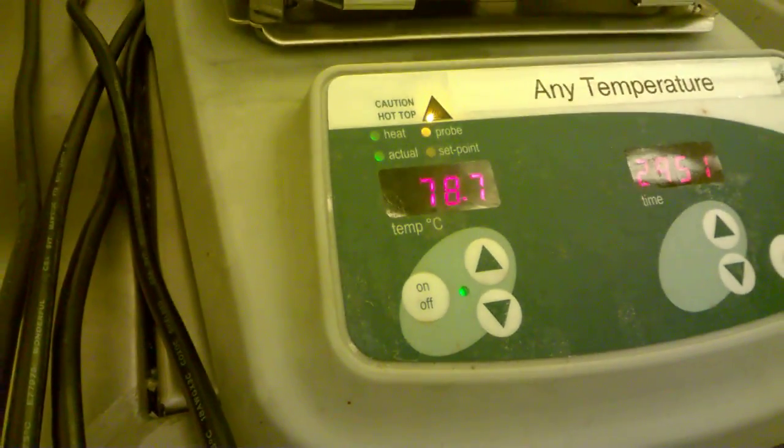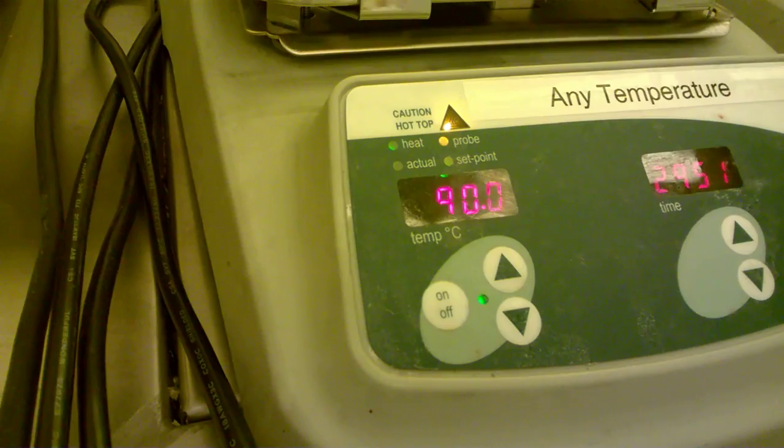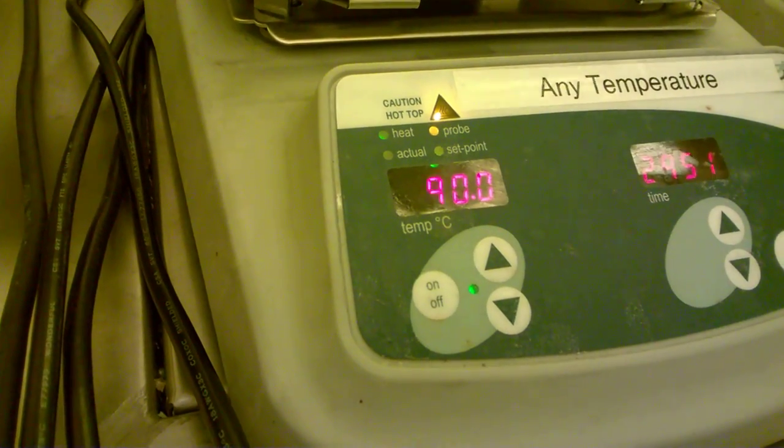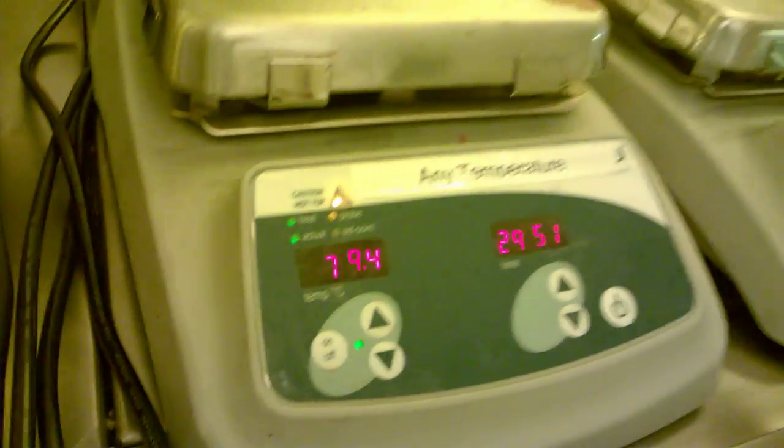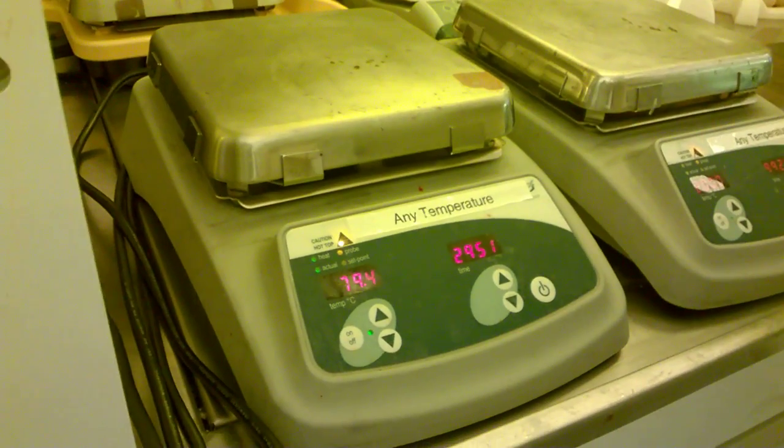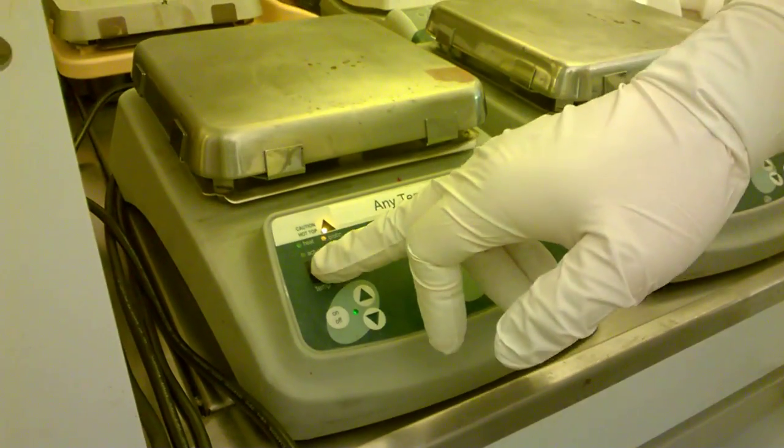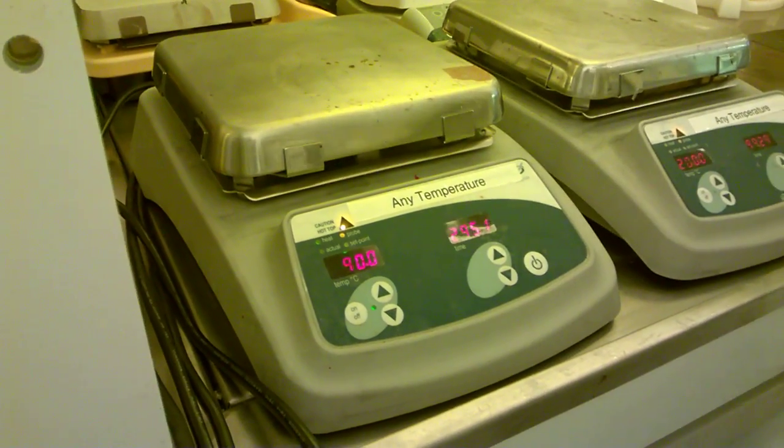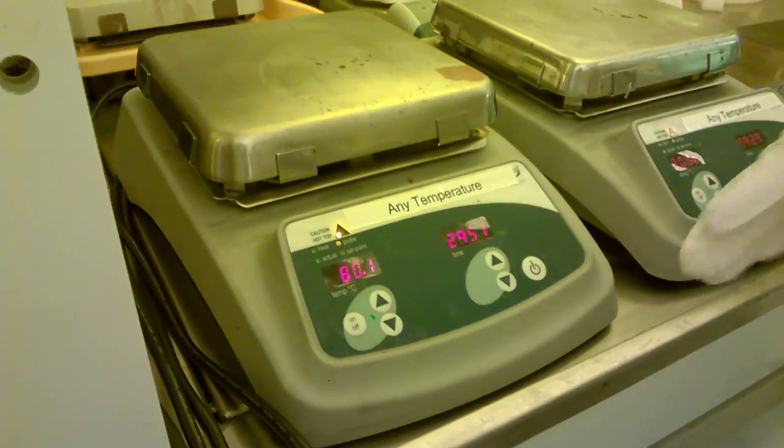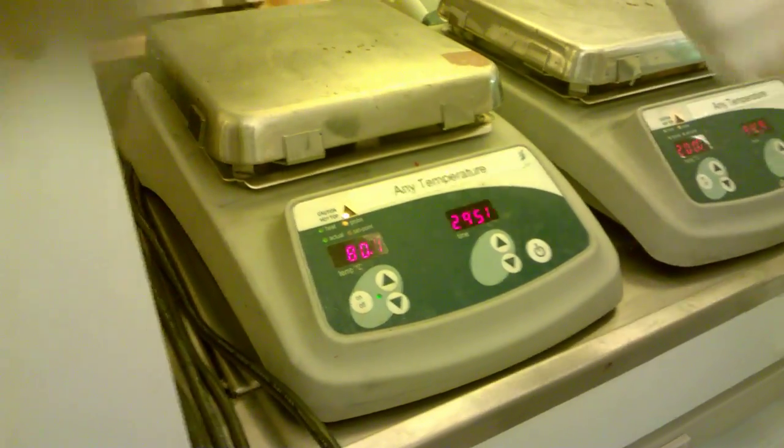After a while, probably a few minutes, you will hear a warning sound. That means the actual value and the set value will be the same, so the temperature will be equal to 90.